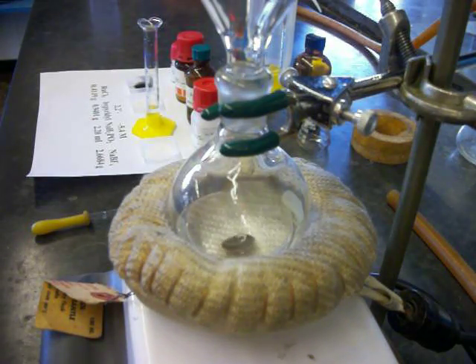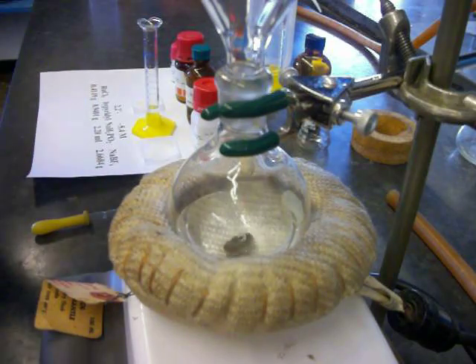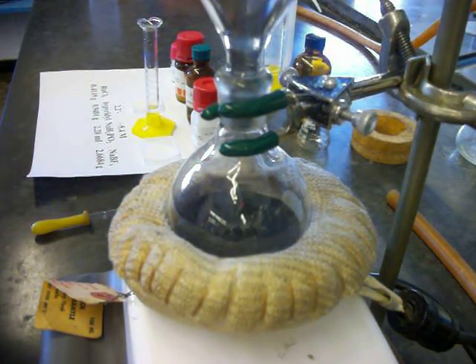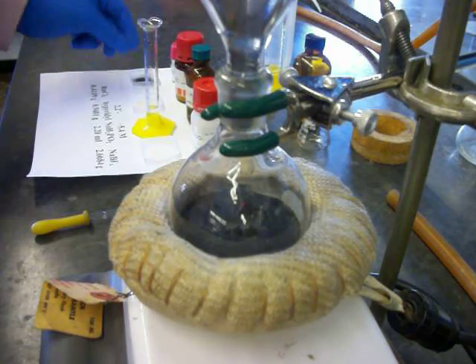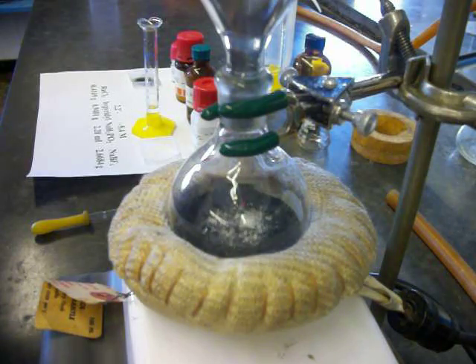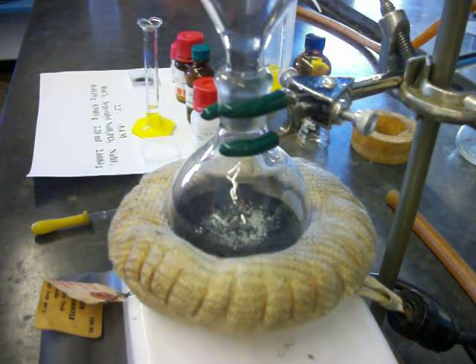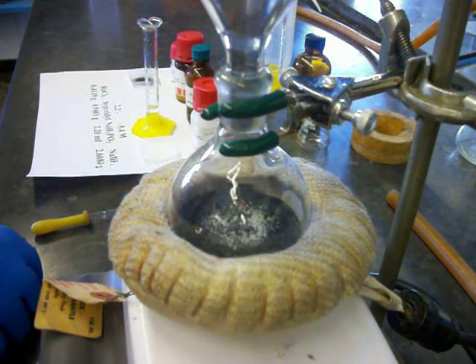Start the magnetic stirrer, and I will first add my ruthenium chloride. It's a nice fine powder — the stuff almost looks like graphite. Next I will add the bipyridyl. What the bipyridyl is going to do is act as a ligand for my product complex. Sometimes I have to play around with the stirrer a little here to make sure that it's going at a good rate.